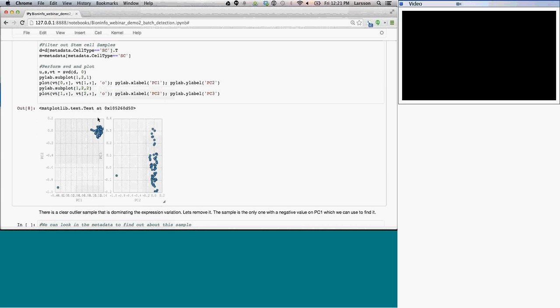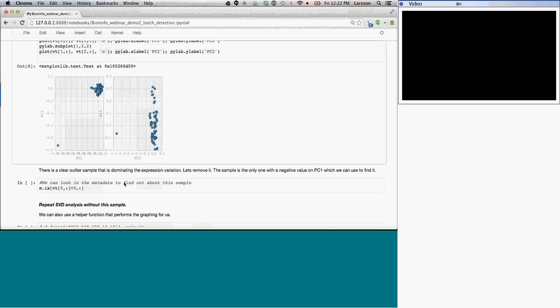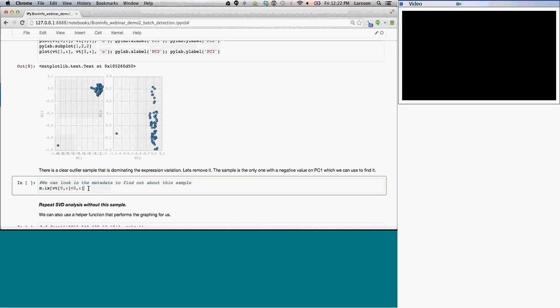But what you see here is that the majority of the variation in the data, so PC1, actually corresponds to the difference between one sample in the set and the bulk of the samples over here. And if you look, it captures this in both PC1 and PC2. This one sample is a far outlier and is actually the majority of the variation in the data. We could go in and try to figure out what this means by looking at which genes are associated with this signature. But I'm going to say that this sample should probably fail the QC analysis as well. And I just recently looked into this, and it turns out that this one has a very strange karyotype as well.